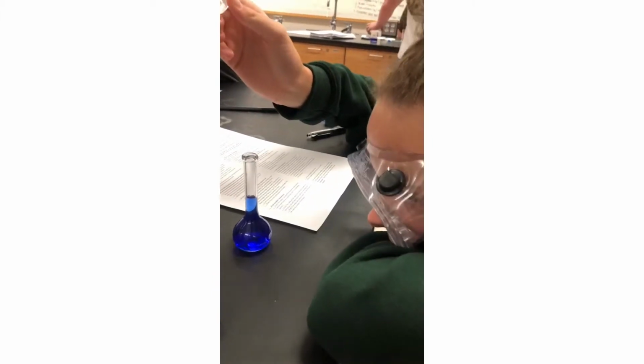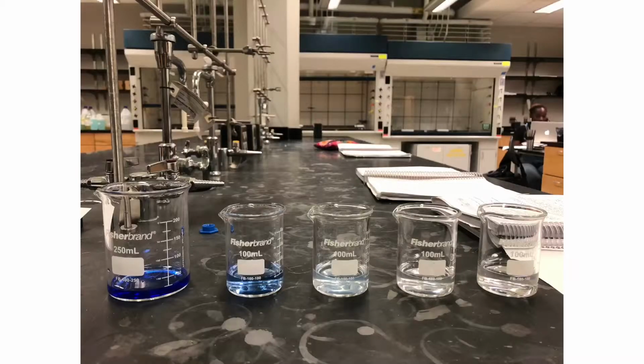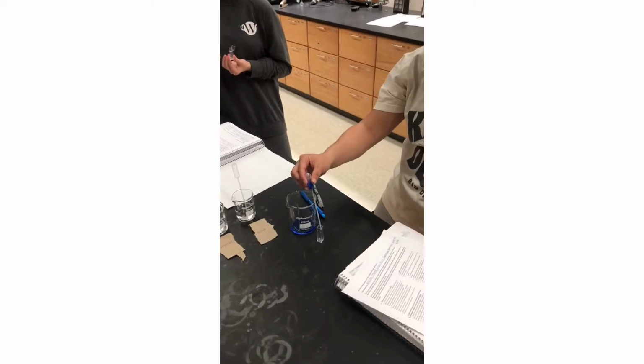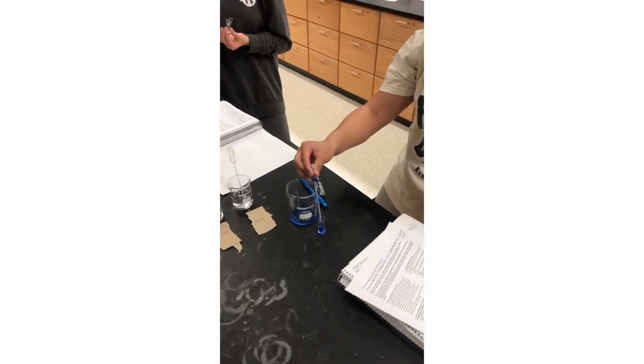You will then add water to your 25 milliliter flask using a pipette until the meniscus sits on the mark of the flask. Do not go over the line or you will have to start over. Now that you have your stock solution, you will need to make a series of 4 dilutions. Once you have your dilutions, move each solution to a cuvette and fill them up 3/4 of the way using a pipette.